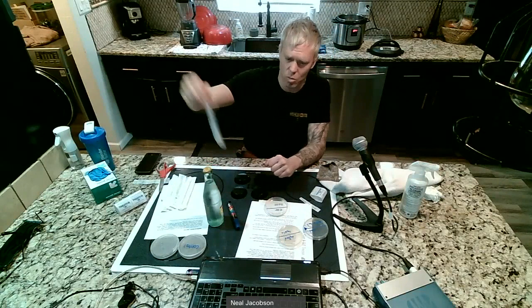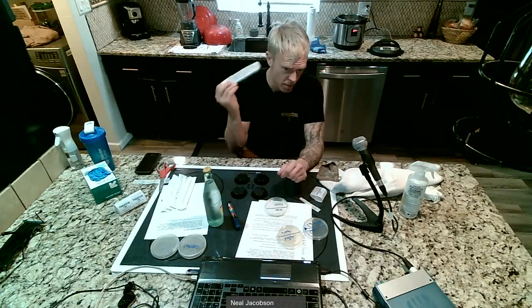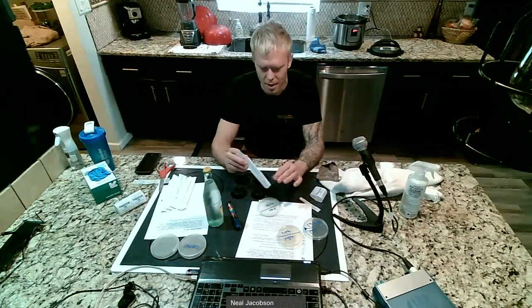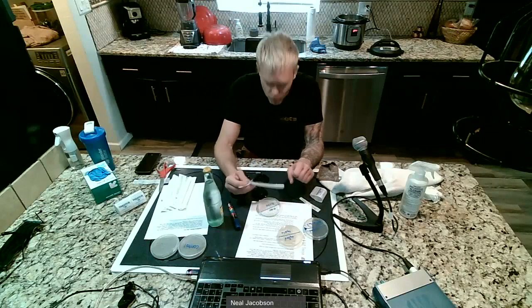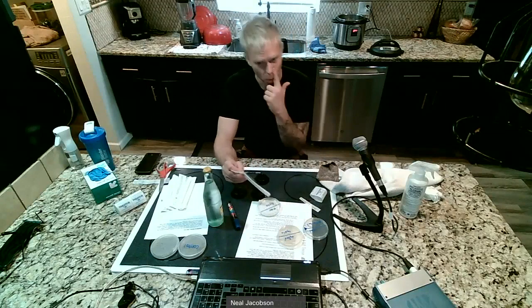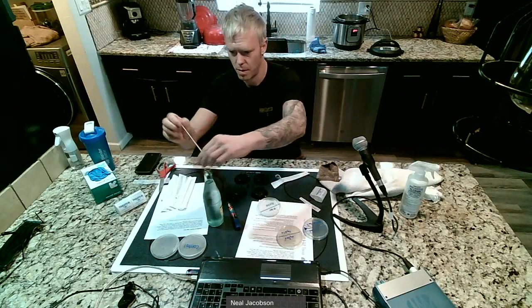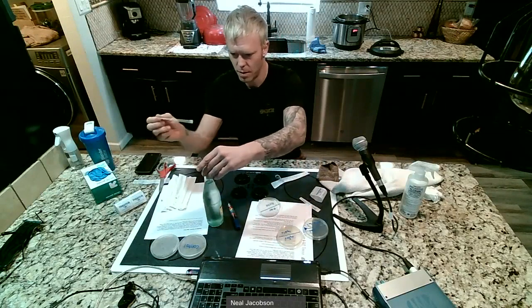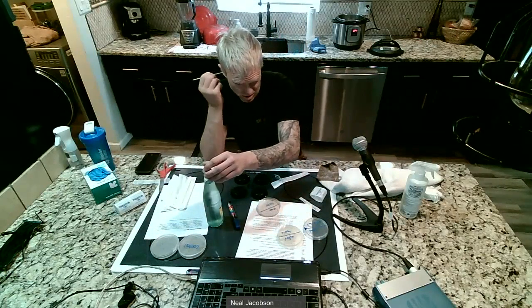And then what we're going to do is take this swab and dip it into the water, whatever your clean water source is. And then for me, I'm going to rub it all over my ear. And then instead of just streaking across the plate once or twice, I'm going to try to cover every square inch on that ear side of my plate with the Q-tip. Okay, so I'm going to do that. Take it out, dip it in my water, and then rub it all over my ear, like the back of my ear, the inside of my ear.